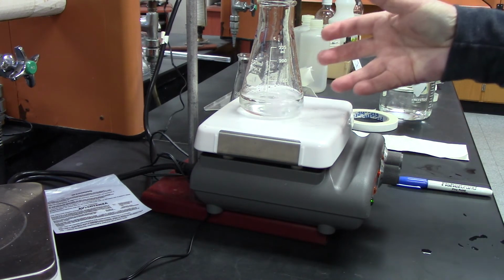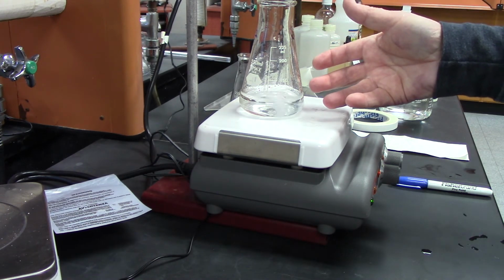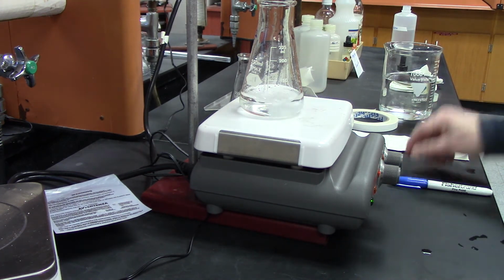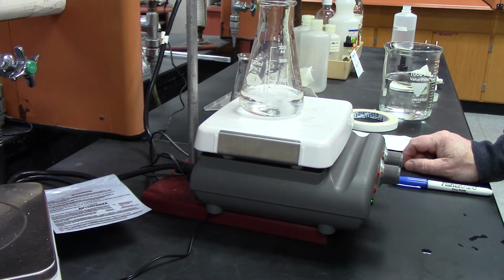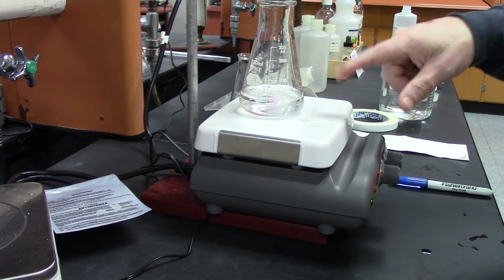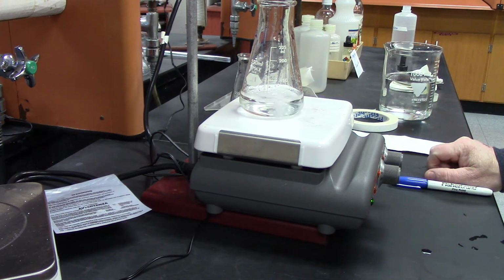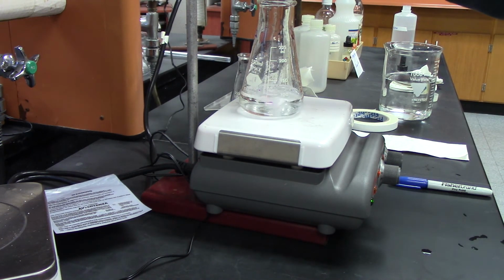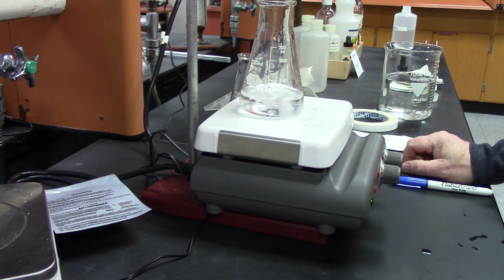So the key here is you know the amount of acid, and you don't know the concentration of your sodium hydroxide. And I'll talk about the calculations. So what we want to know is the concentration of the sodium hydroxide, and we're using the known amount of the KHP to figure that out. Okay, so it's about 34. Okay, so it should start getting close.